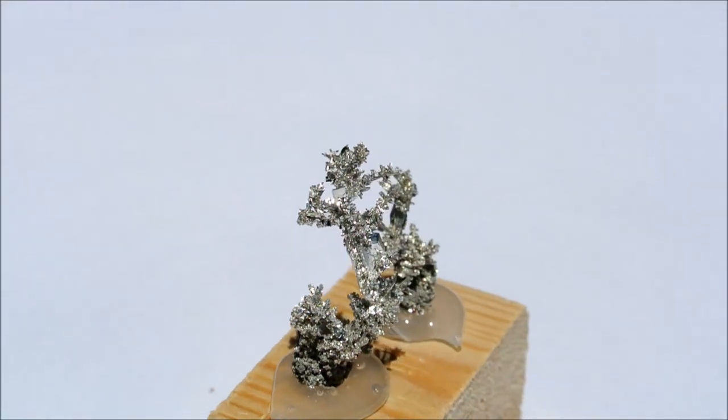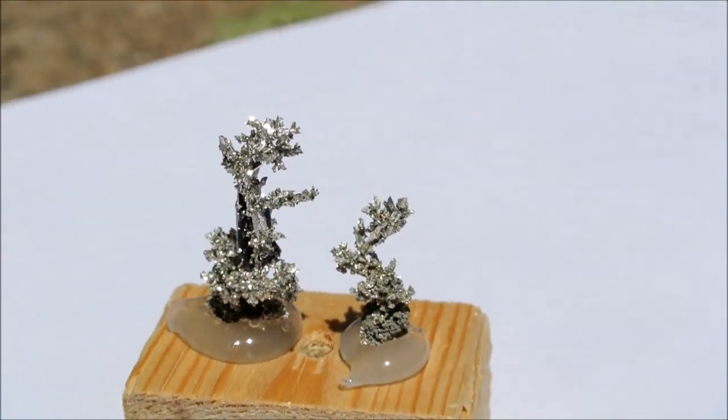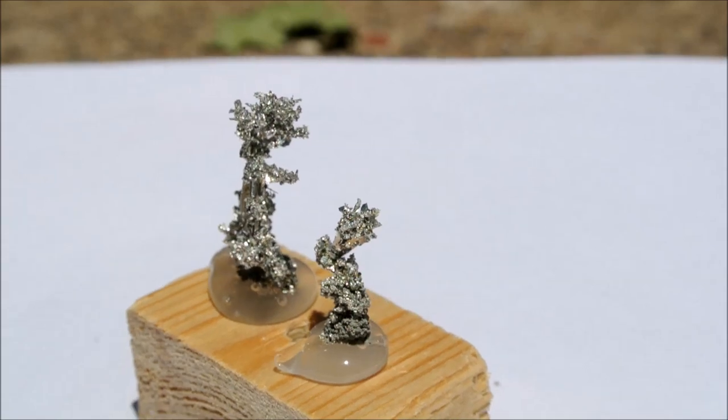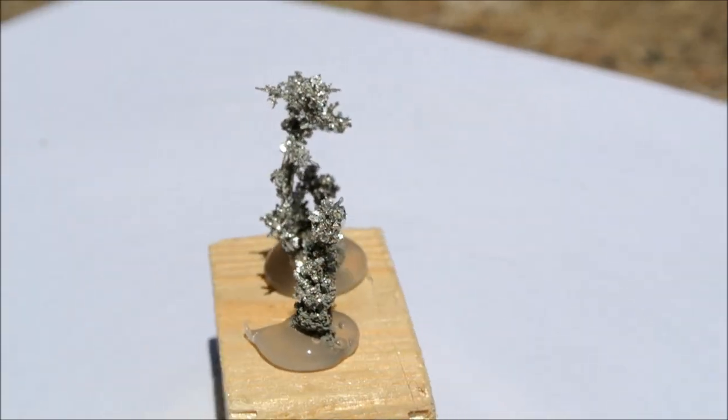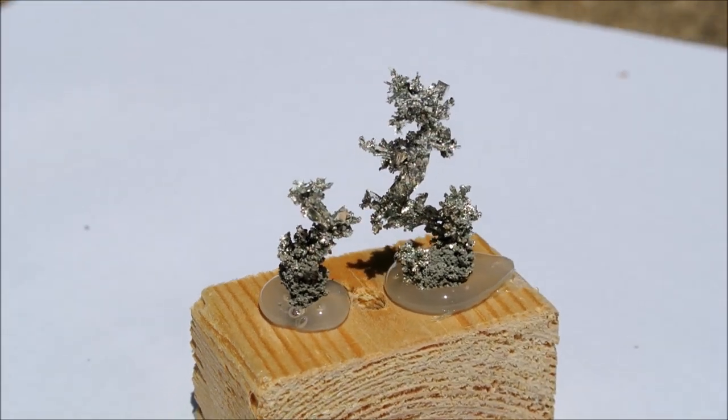The resulting crystal broke into two pieces as a result of a period where tin was not depositing, so it's always important to make sure that even if the voltage is low, tin metal is still depositing as evidenced by growth on the crystal tree.